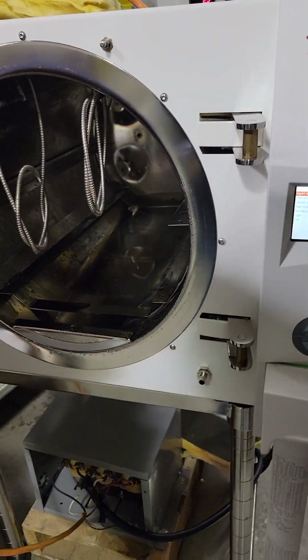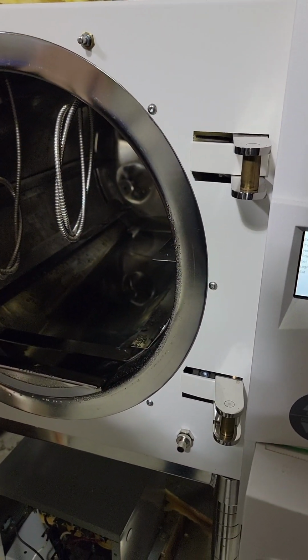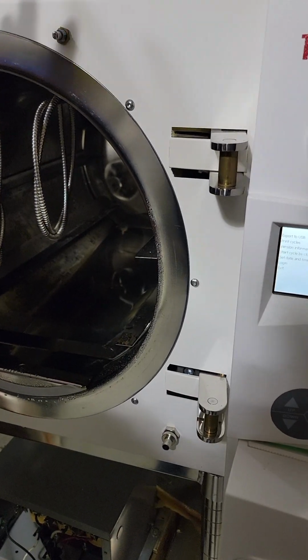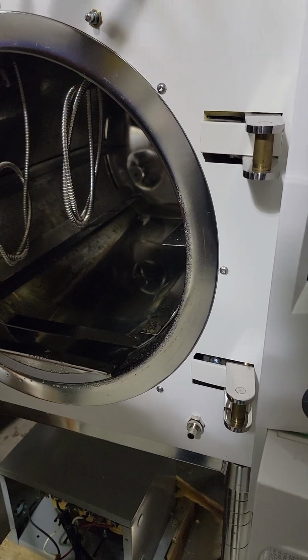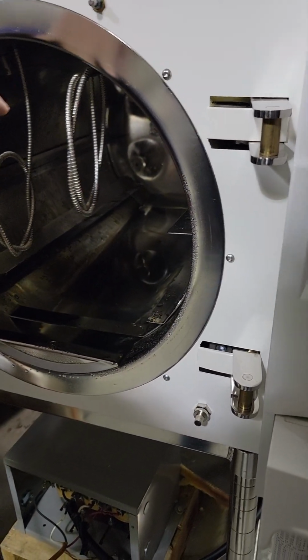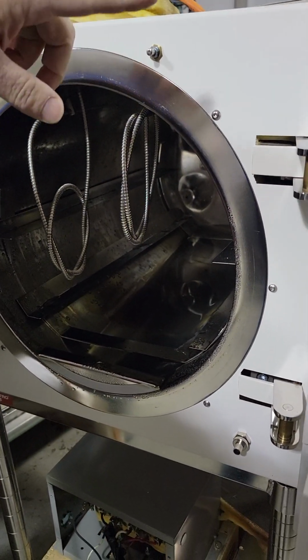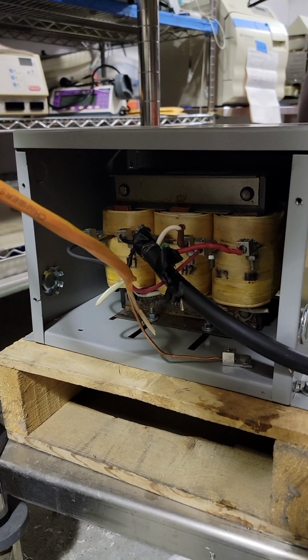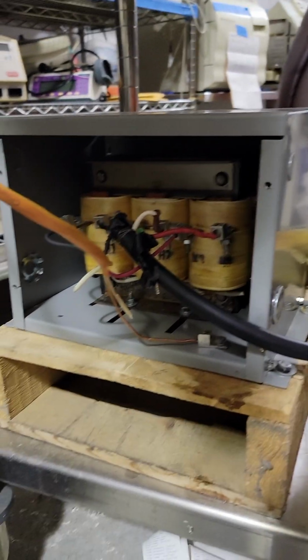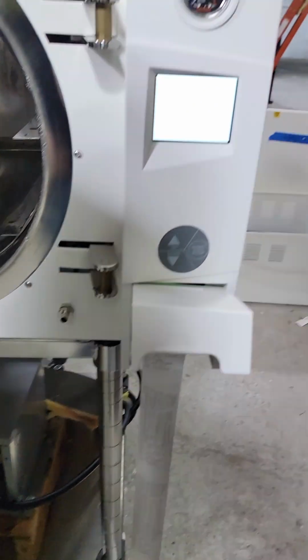Also, every 3870 requires a buck boost transformer somewhere in the circuit, because you have to have 230 volts stable. Can't do 208, 212, 224, whatever. It's got to be stable, so you need a buck boost transformer. This bad boy isn't single phase as most 3870s are. This is a 3-phase 208 to 230 volt transformer. Yeah, about $600. Anyway, back to where I was.